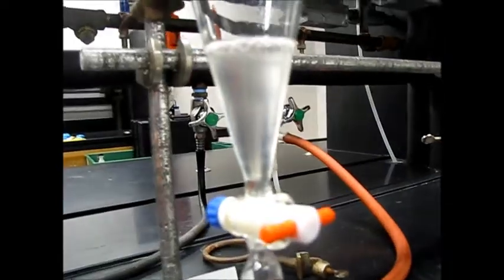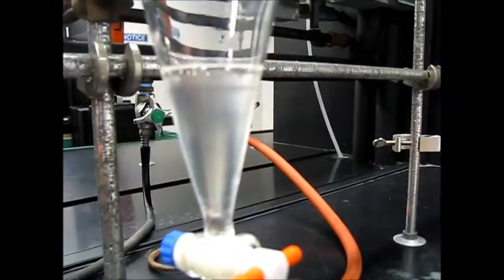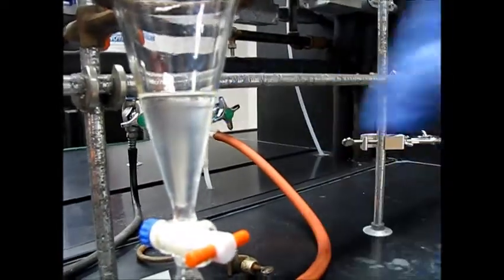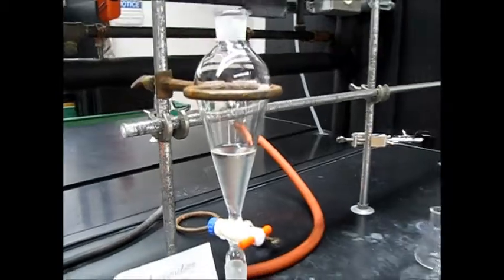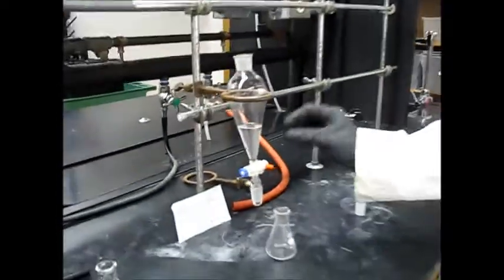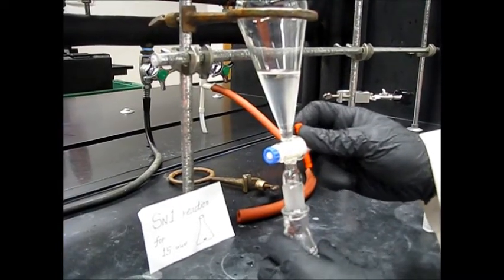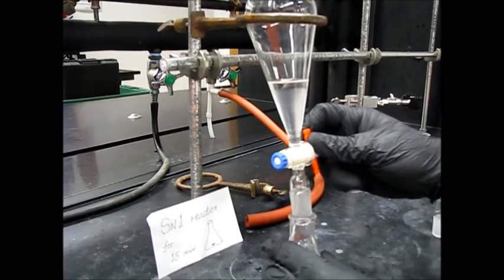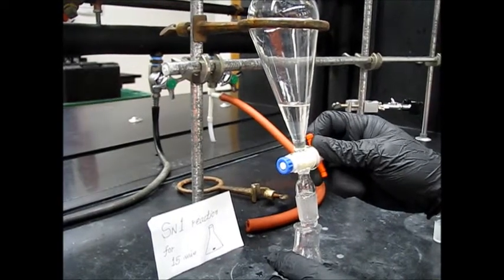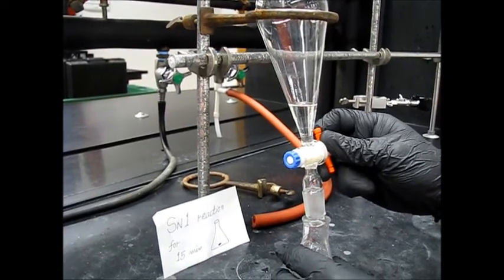Wait for the two layers to separate — you can see two phases forming. Drain out the aqueous layer from the bottom and keep the top layer. The two layers have separated; there is a small upper organic layer. When draining, watch carefully to not lose your product from the top — as you get closer to the interface, slow down and then stop.